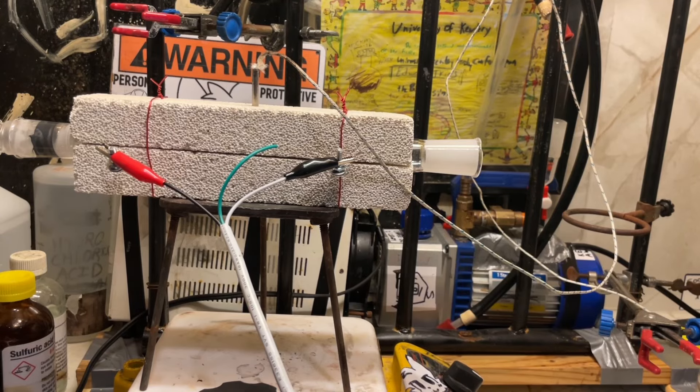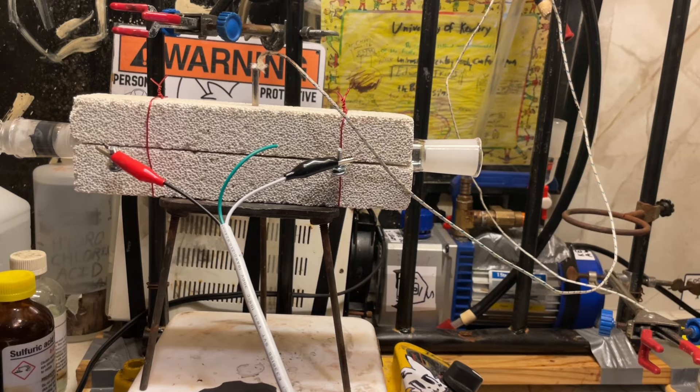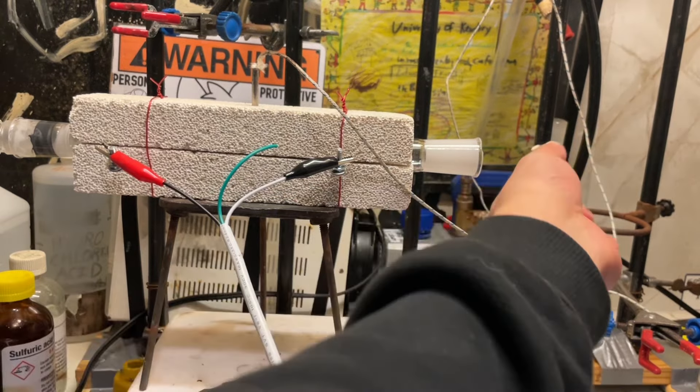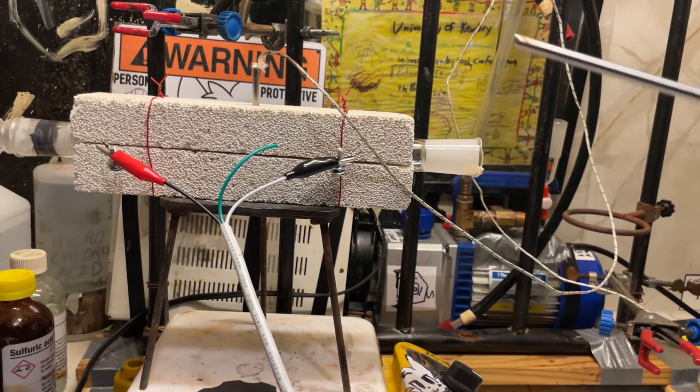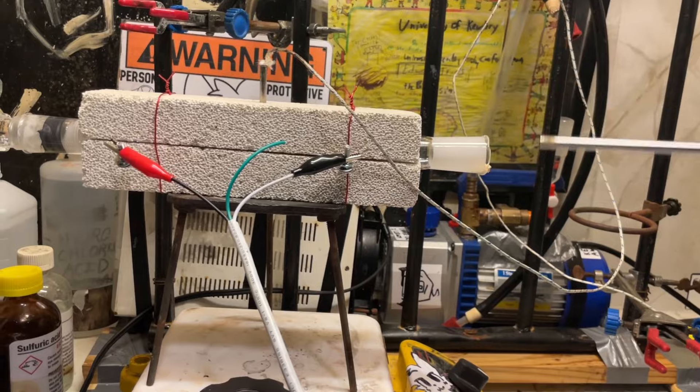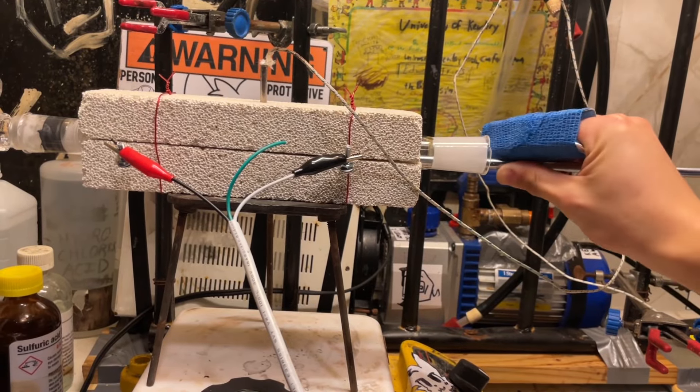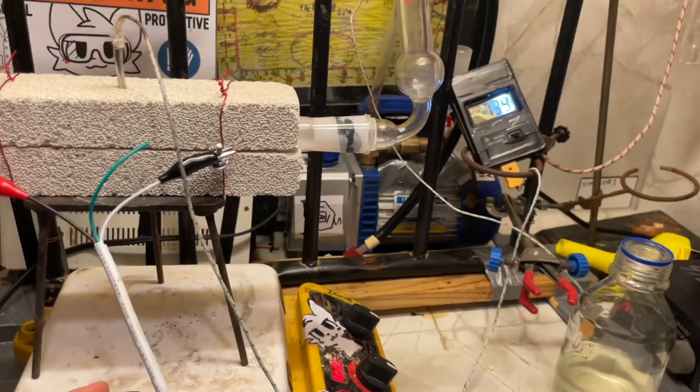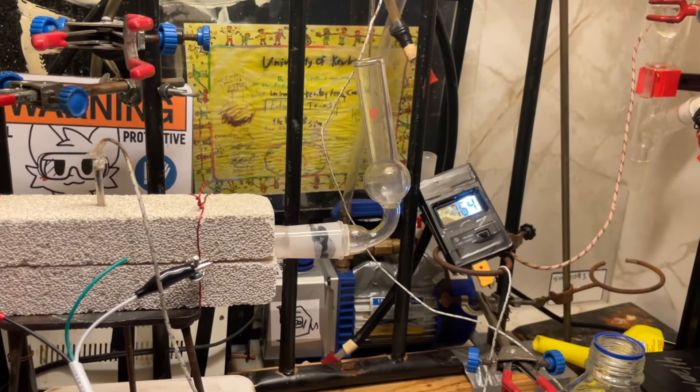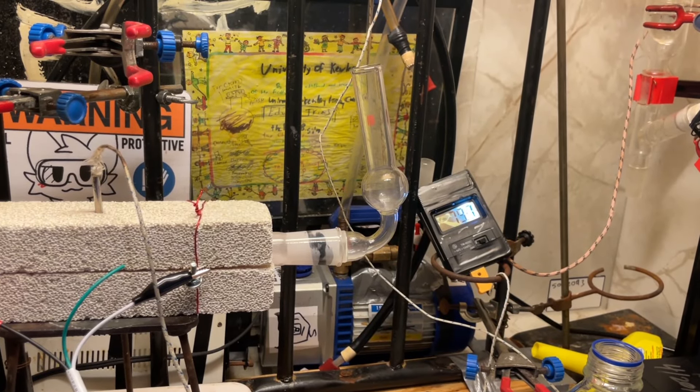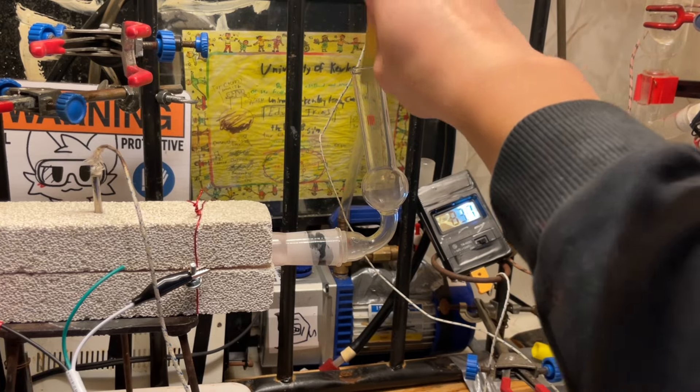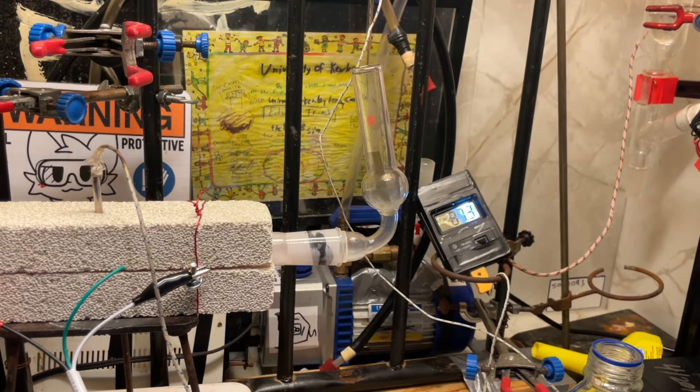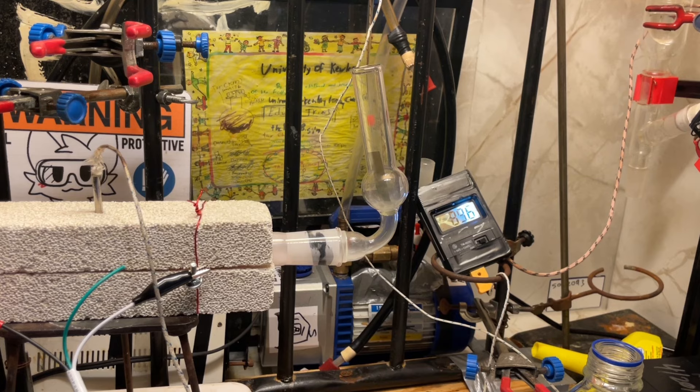Okay, I got the tube furnace set up. So I'll go ahead and put this chunk into the furnace. Got powder everywhere. We're now about halfway in. You can see some smoke. I can hear boiling. So I would say that means that it's definitely decomposing. Let's put this pH paper in. And you can see ammonia. Or at least some kind of basic gas. So there we go. We've made azodicarbonamide.